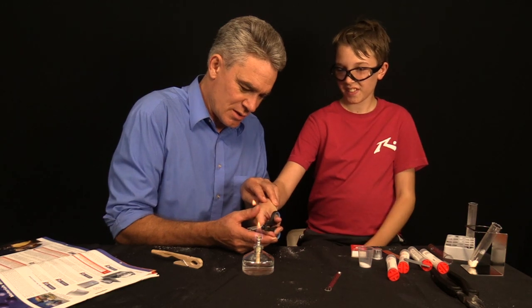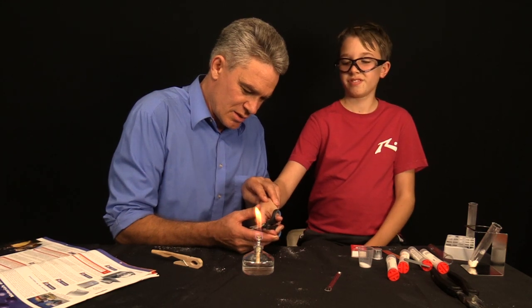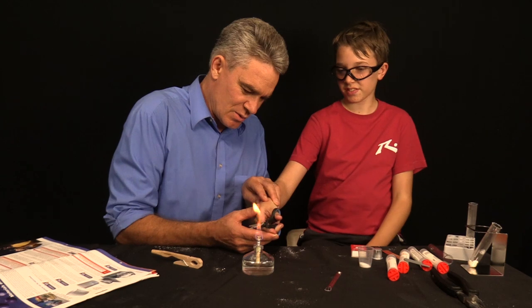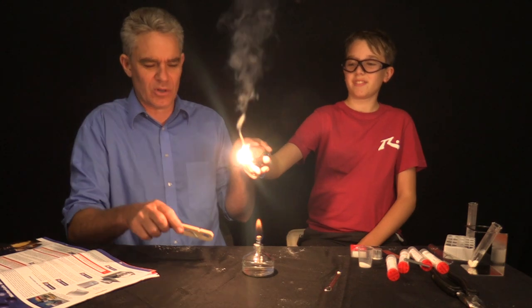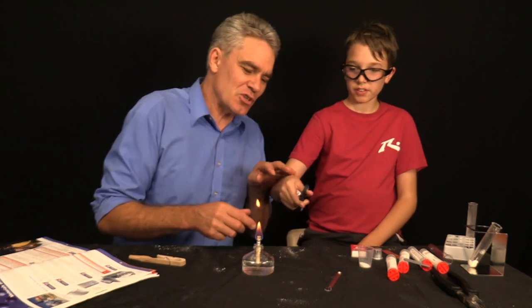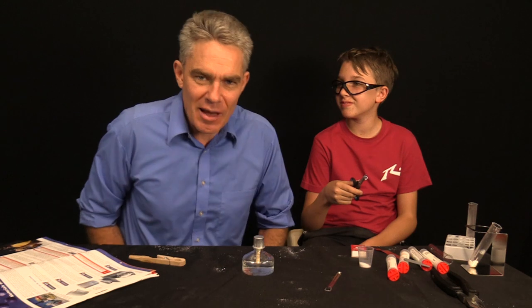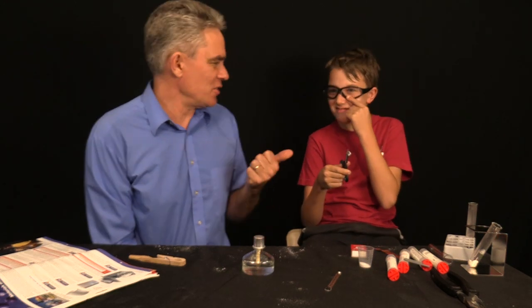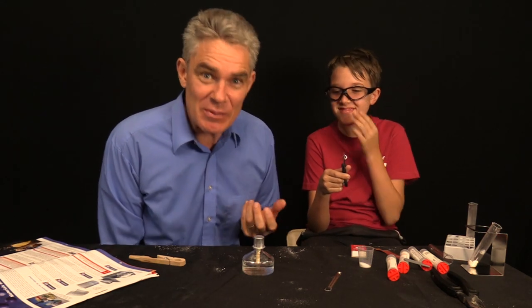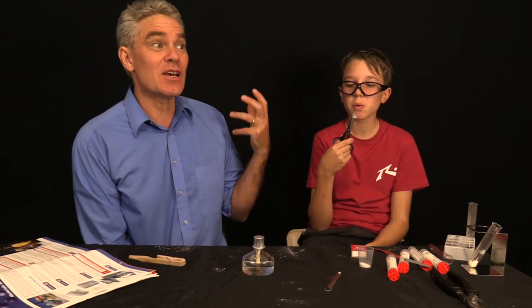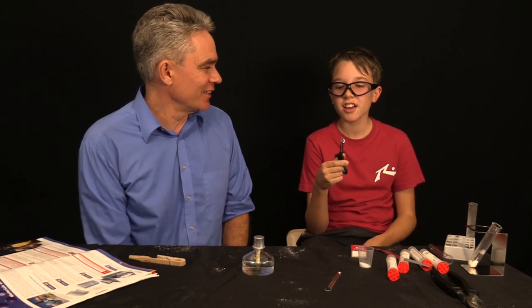This spirit burner doesn't produce intense heat, does it? Come on. I'm trying to get to the part of the flame which is the hottest. Come on. Oh. Hey!